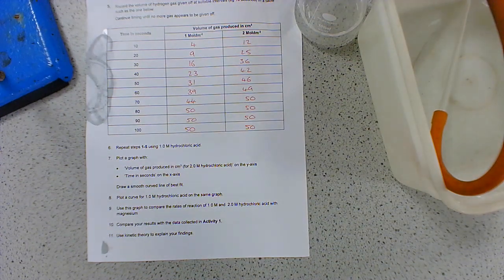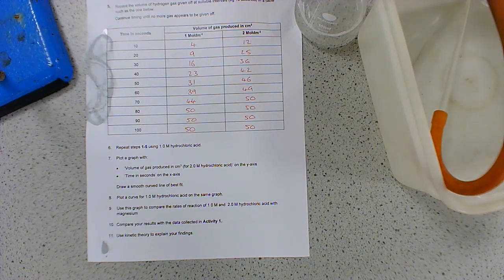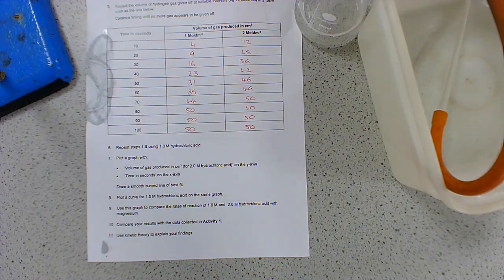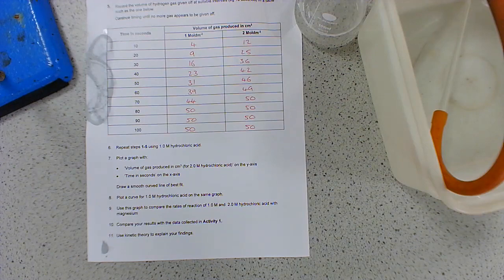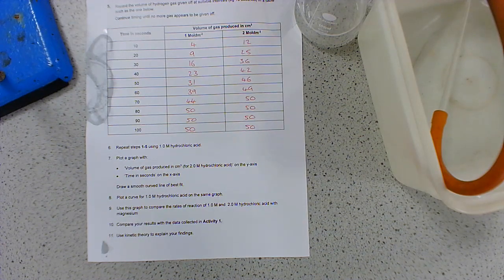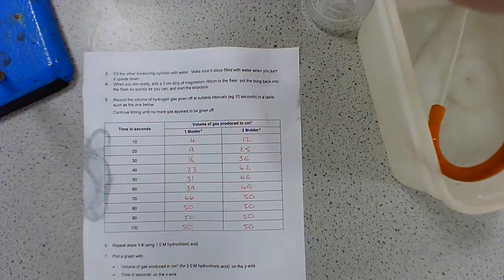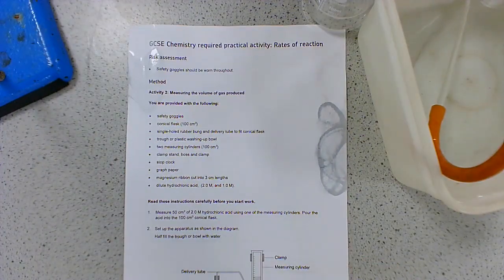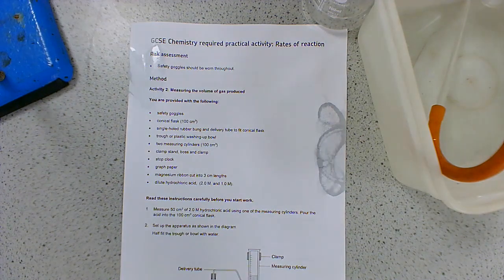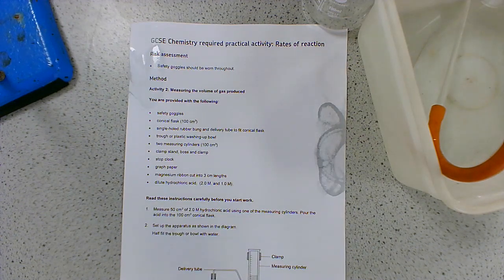It's really important that you are familiar with these experiments, because there will be exam questions that use these as examples, or use very similar experiments in the questions. It's really important that you are familiar with the methods. When we write methods, it's really important that you specify actual values - what volume are you using, what concentration, what mass. You don't have to memorize the exact measurements from this particular experiment. You could say 50 cm³ or 25 cm³ or 100 cm³ - it doesn't matter as long as it's a reasonable value. Make sure you're familiar with these methods so that you can write one if asked.